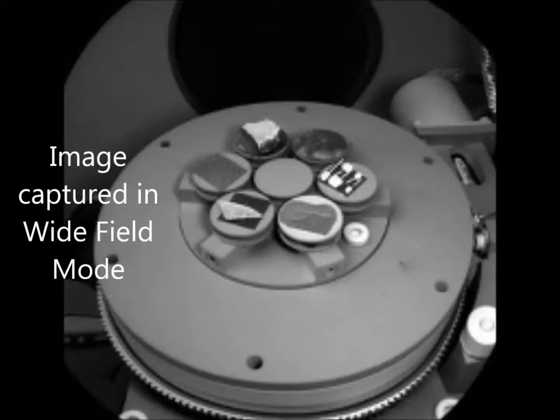To know the proper magnification value, the objective must be well focused. This might be a bit difficult due to the high depth of focus. The purpose of this mode is an extra large field of view. Image distortion is corrected and minimized.